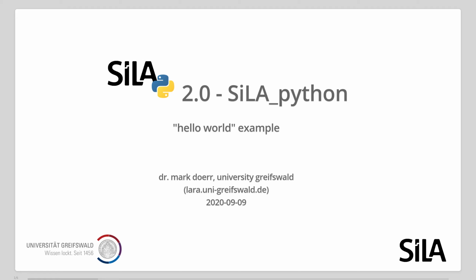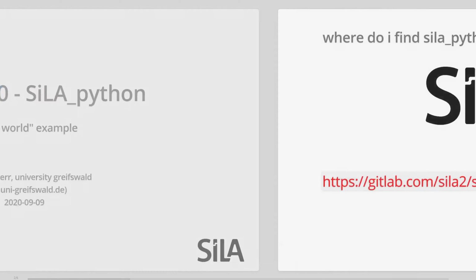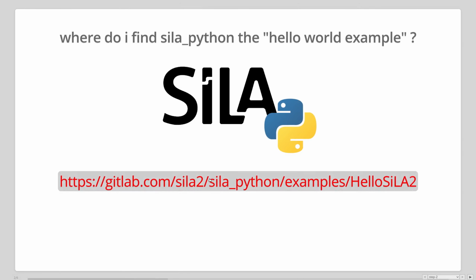And today I would like to show you the very simplest SiLA Python client server you can have, which is also an example in our repository. You will find this whole example completely on GitLab, in the SiLA2 group, in the SiLA Python repository, in examples, Hello SiLA examples.